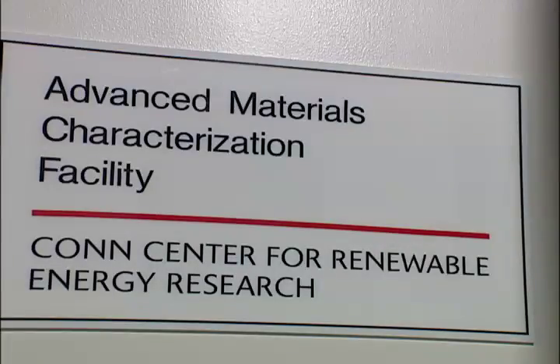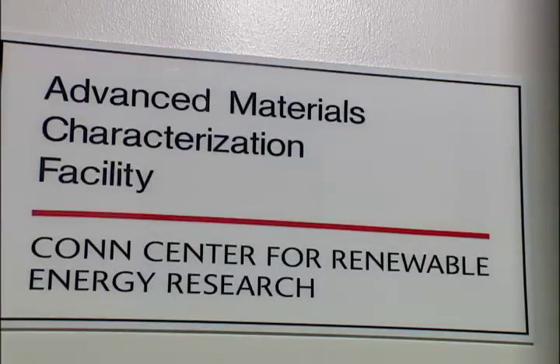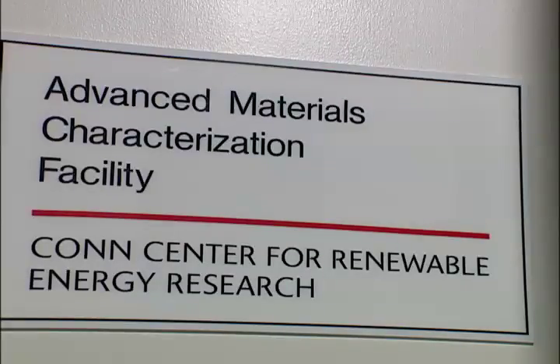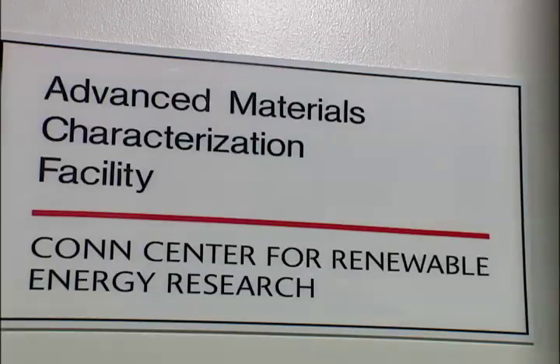The purpose is to serve the community — the research community at the UofL and neighboring academic institutions as well as industry — and provide materials characterization services.